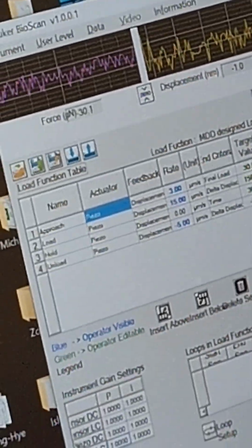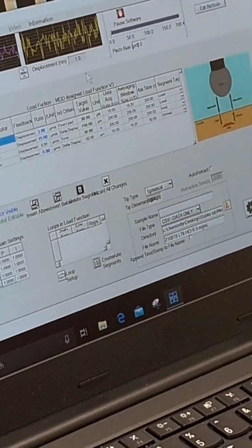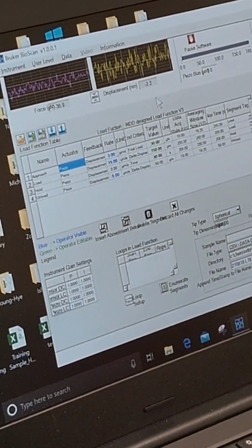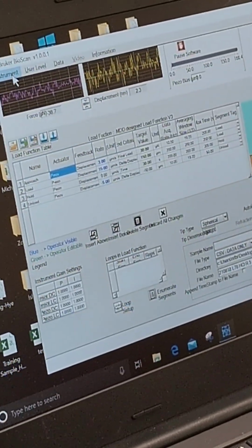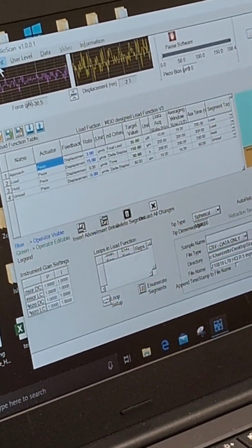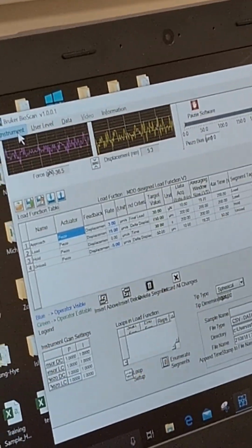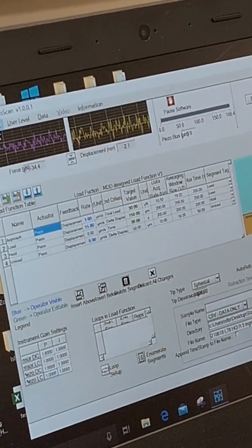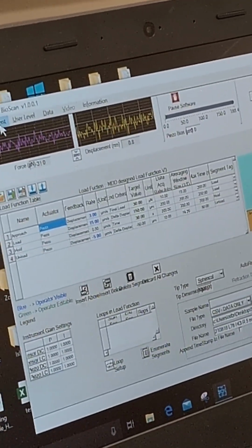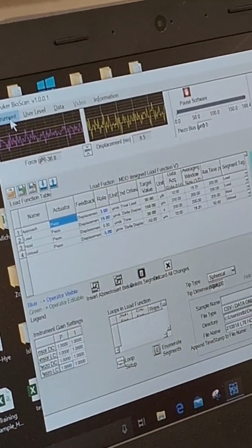So let's just say we go through the entire indentation protocol. We stop, we pause the bioscan, we install the probe, and now everything is done and ready. So the next thing to do is calibration. Again, based on the sample that you have, we are not doing anything submerged. If you are trying to do hydrogel submerged simply because you have too many samples, and when you put the sample here and it's waiting too long, the hydrogel starts losing moisture and it changes physical property, you may want to submerge your sample.